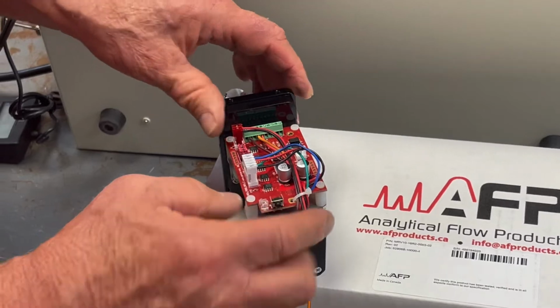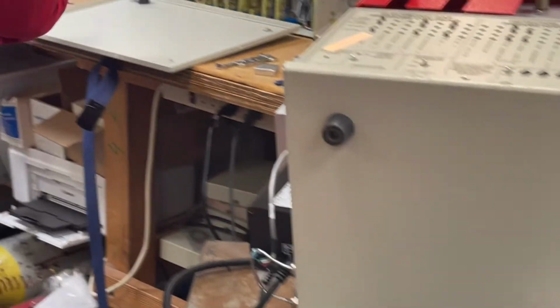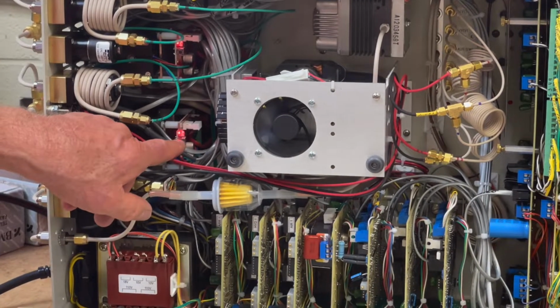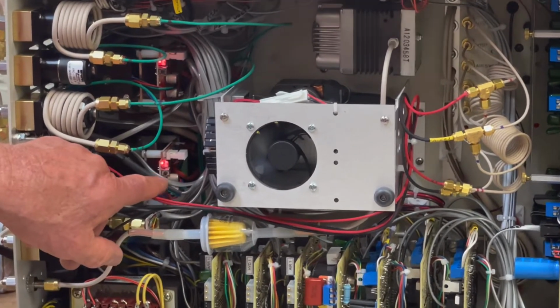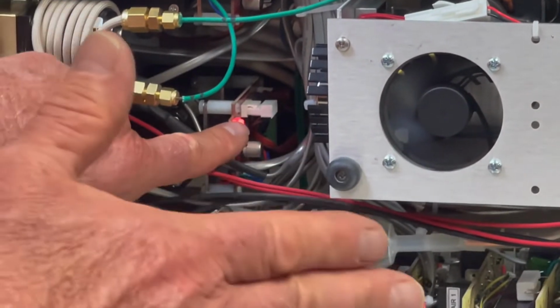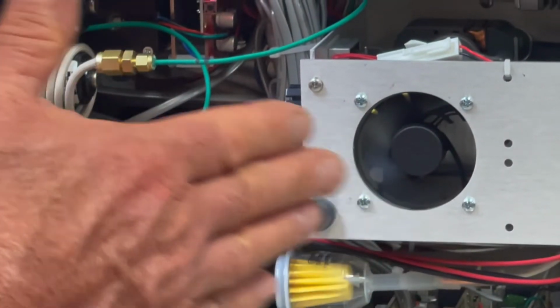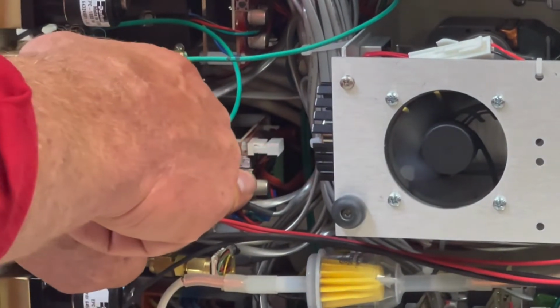Now that's how it works on this particular type of valve, and this is what it looks like when it's mounted inside the GC. You can see it's kind of crowded in there, but you can push the button, and you have to hold the button in for 3 seconds, and then that tells it to go and reset everything. So watch what happens, and of course listen. There's a peculiar sound that happens when the motor is hunting back and forth to feel where it should stop on this end and where it should stop on that end. And it does that by sensing where it hits an obstacle. So here it goes. I'm going to do the configuration by holding down the button for 3 seconds and see how it starts to flash now.